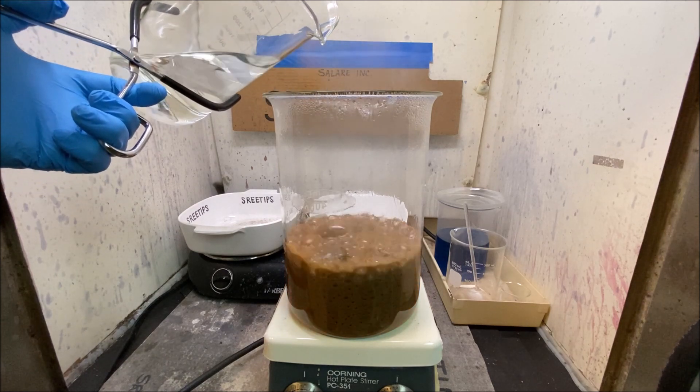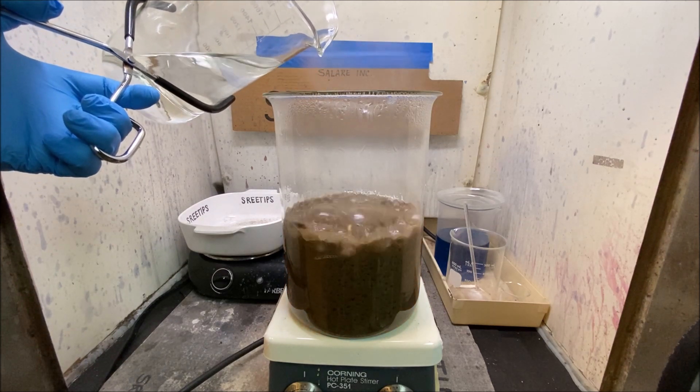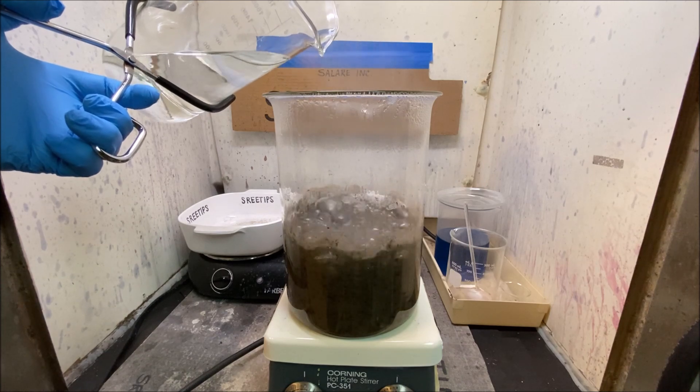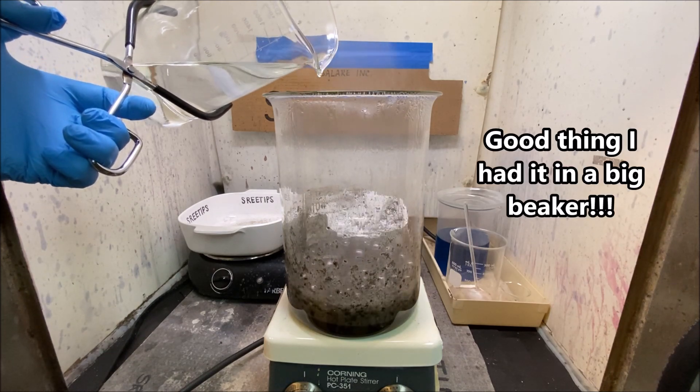Oh wow, look at that! Look at that! Oh my gosh, that is freaky.